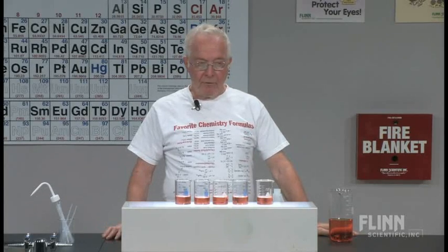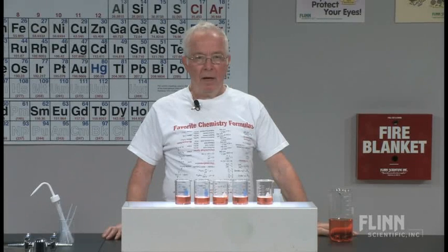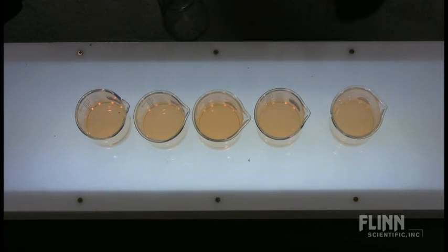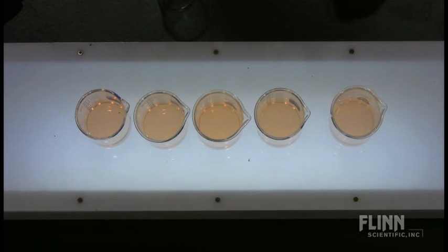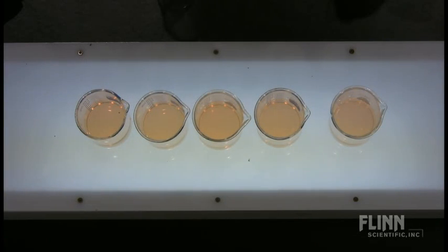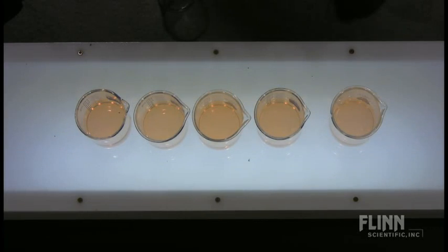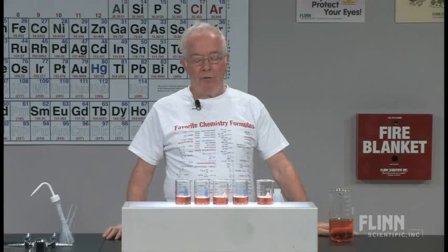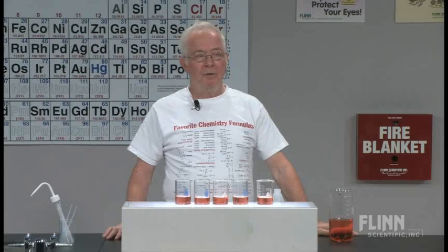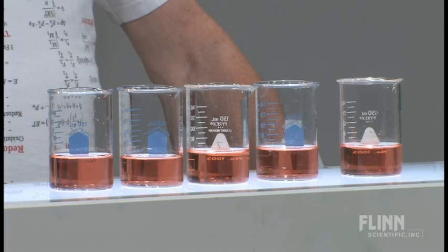For example, if they look at these five beakers — and if we can have the overhead shot please — if they look at these five beakers on an overhead shot, they look identical. Now if we can have a horizontal shot, if you look at these five beakers again, they all look identical.